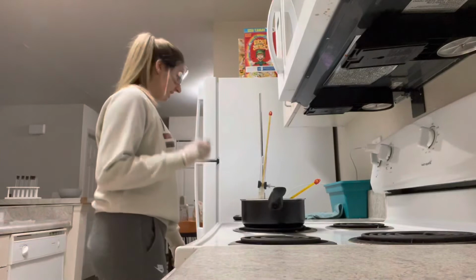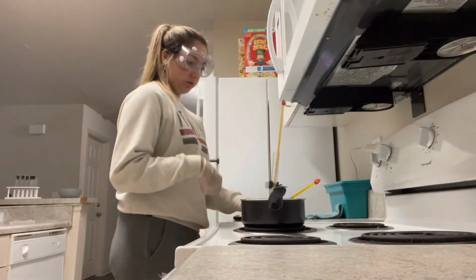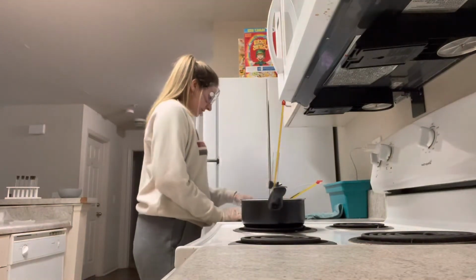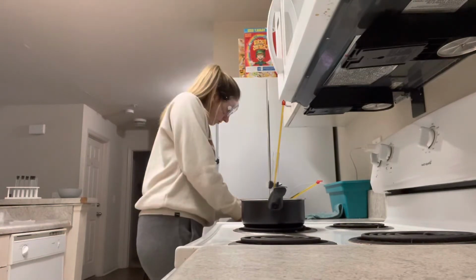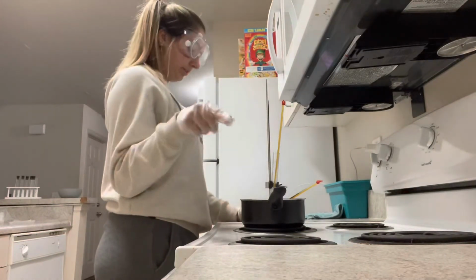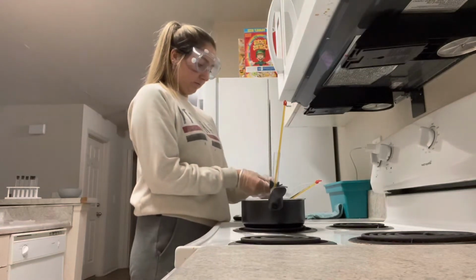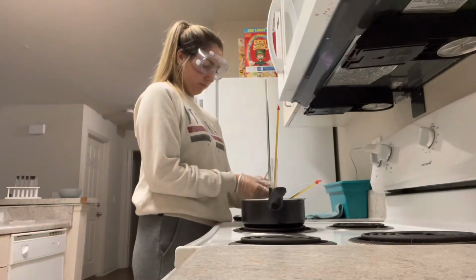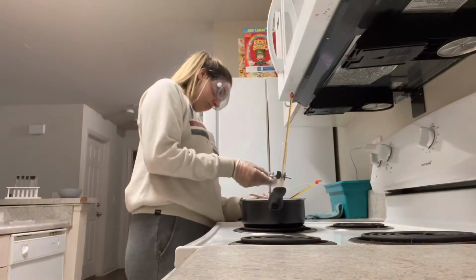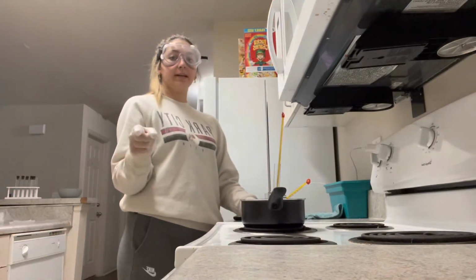Okay, so as this heats up, I've started learning more what to do. So I'm going to get my starting temperatures down. Actually, I'm going to go ahead and drop it into the bath. Now we go back to freezing.